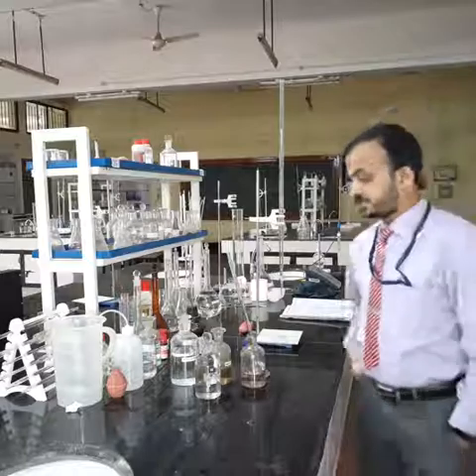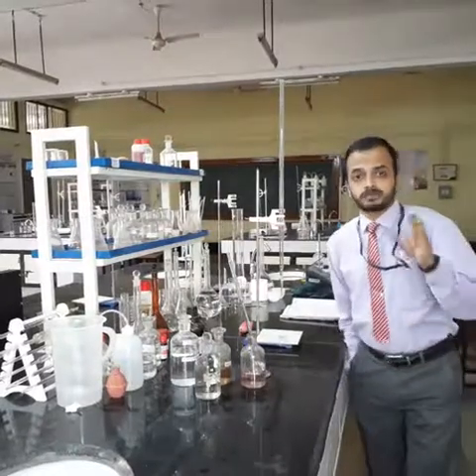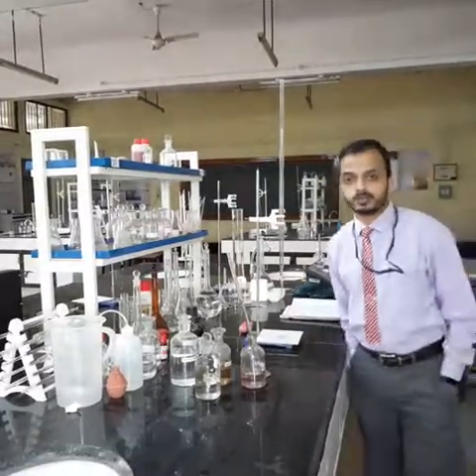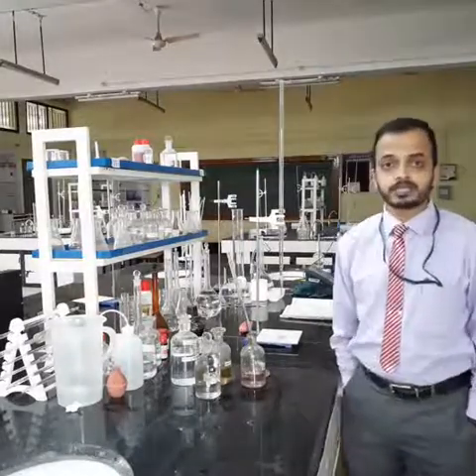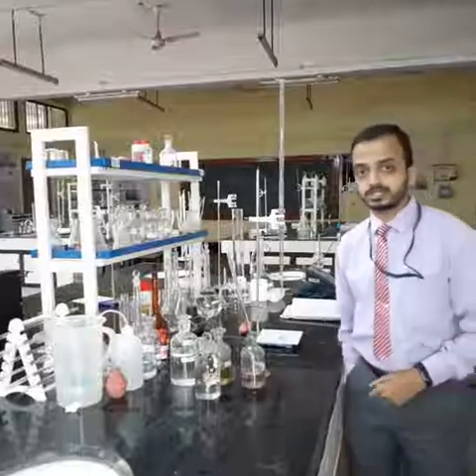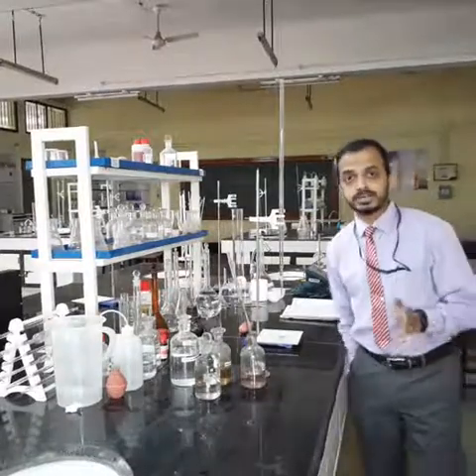So DO, we call it dissolved oxygen. It is nothing but the oxygen that is dissolved in water, or that is present in the dissolved state in water. As you know, there are surface sources and subsurface sources of water. The gases that are present in the atmosphere will naturally be present in the water in one form or the other. Especially oxygen and nitrogen are present in very small quantity because they are poorly soluble in water. So the water has dissolved oxygen based on the temperature and pressure.